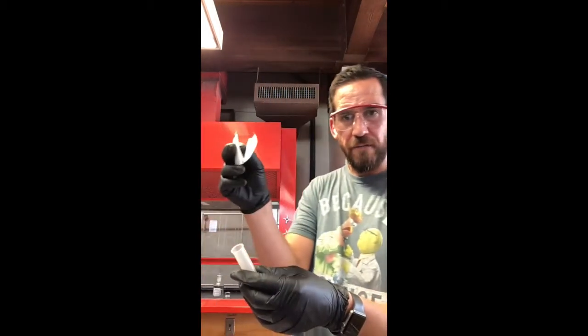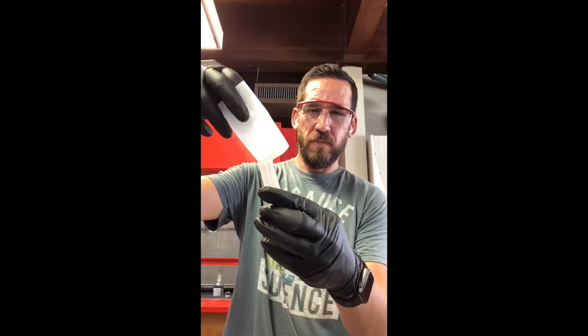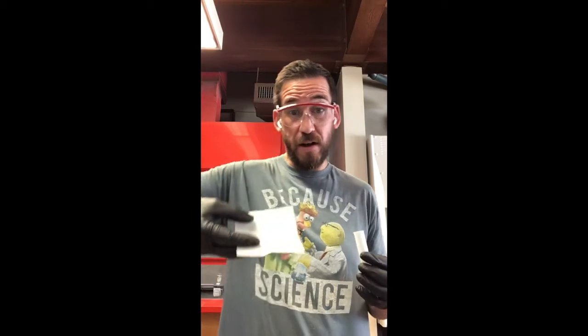And remember, I folded this nicely so it's got that V shape, so I can easily just kind of tilt it and pour that in there. Now, if you do spill any, depending on the experiment that you're doing, you would probably have to start over. So you want to be really careful when you do this. And I don't really have any on here anymore, so we are good.